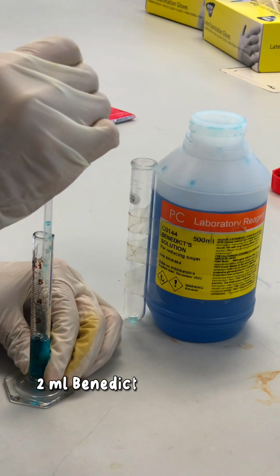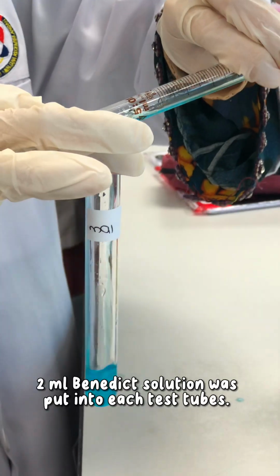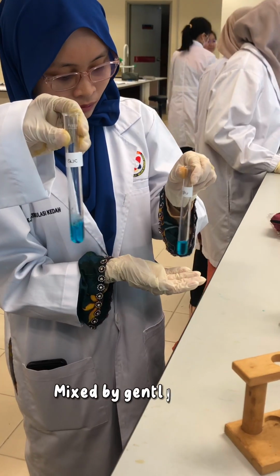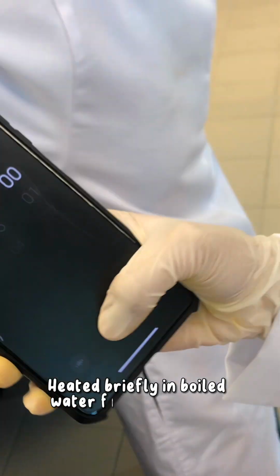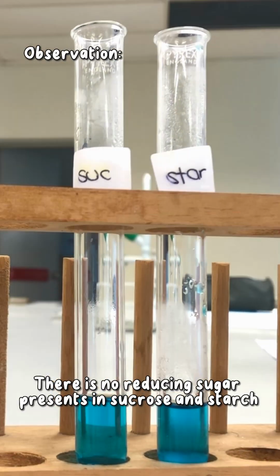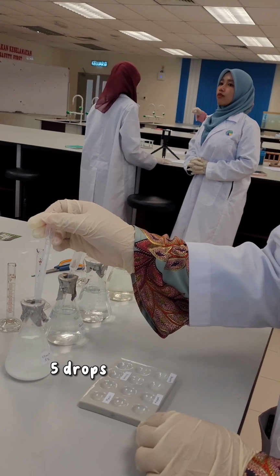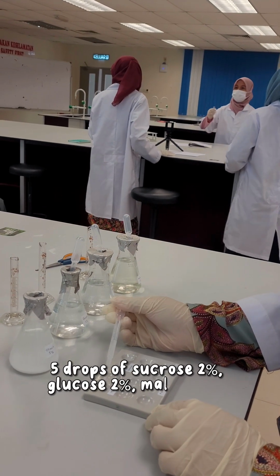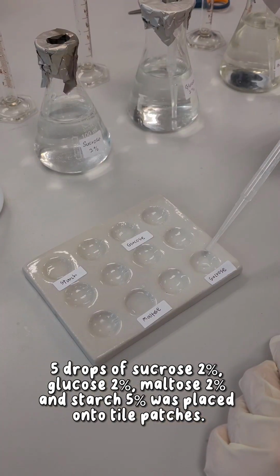Next, 2 ml of Benedict solution was put into each test tube and mixed by gentle shaking. Furthermore, they were heated briefly in boiling water for 2 minutes. The result was observed.